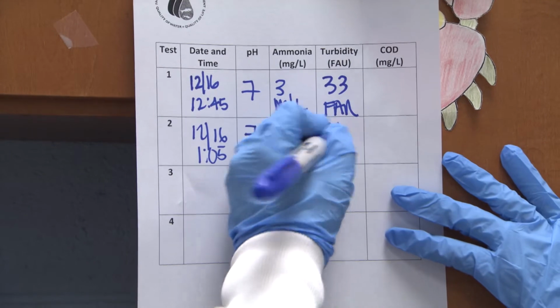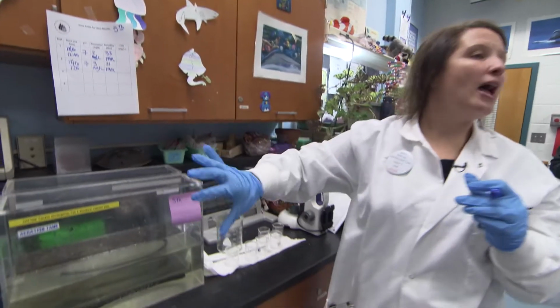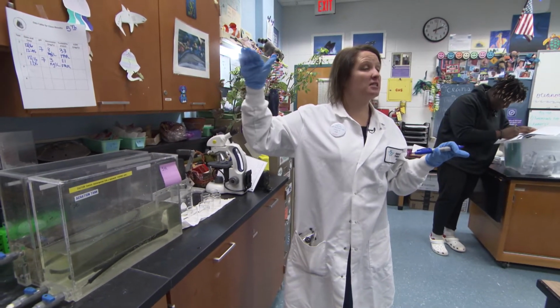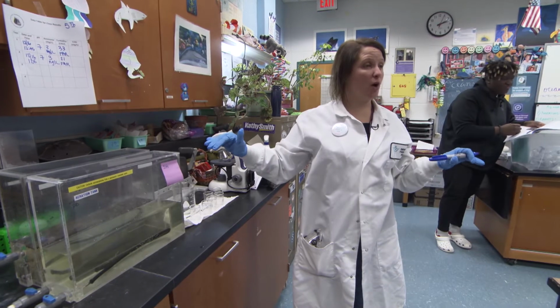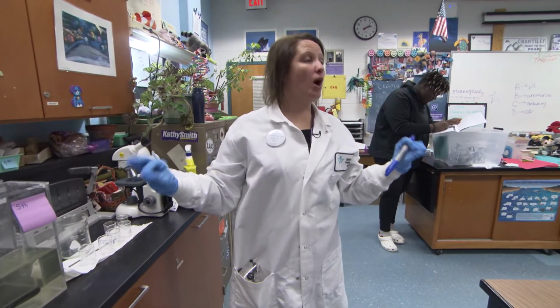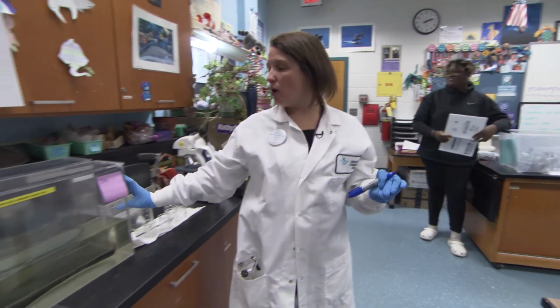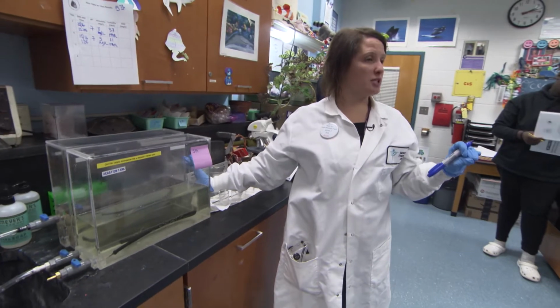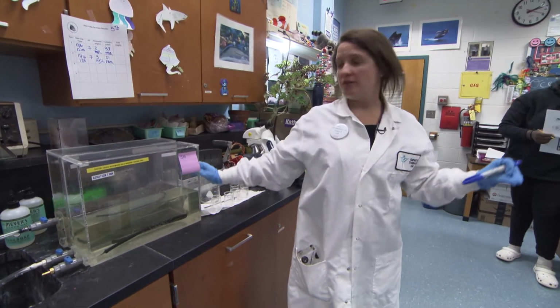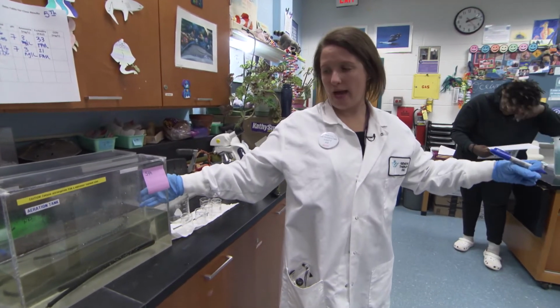21, was that a change? Yes, that was a pretty big change. So without ever using any energy, we were able to decrease the suspended solids in our wastewater just by letting it sit. Okay? While you guys were doing the lab, your tests, Rita took off that middle layer of suspended water, which was mostly just water. Okay? The suspended stuff is left behind, the plastic, the coffee grounds, the toilet paper, and that kind of thing.